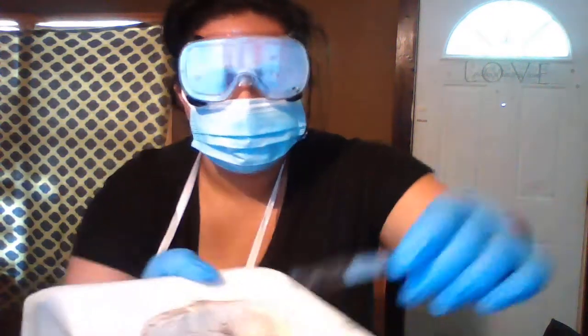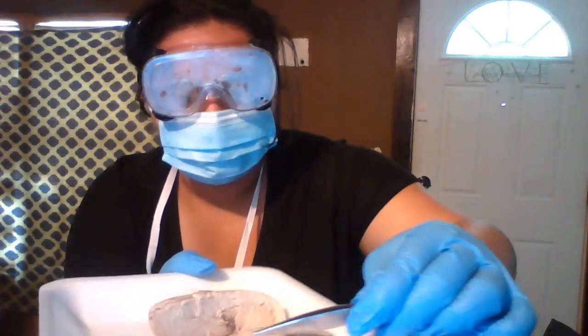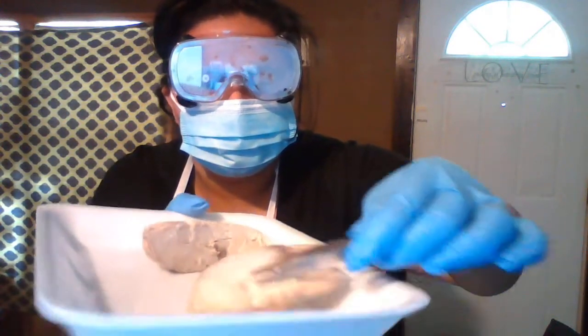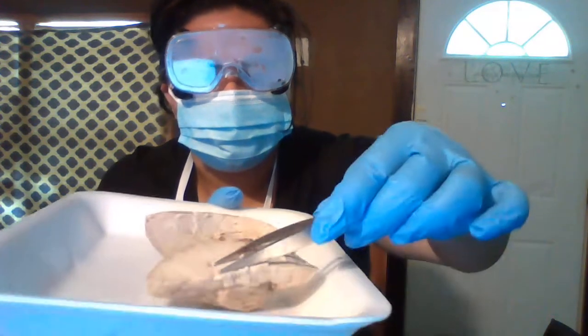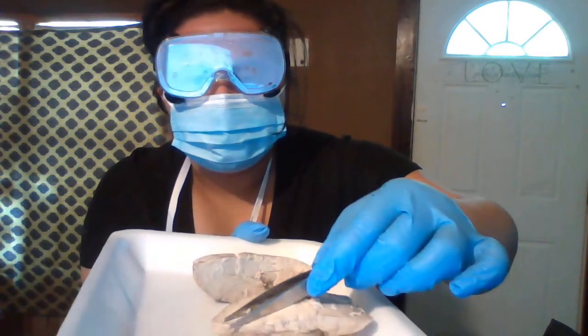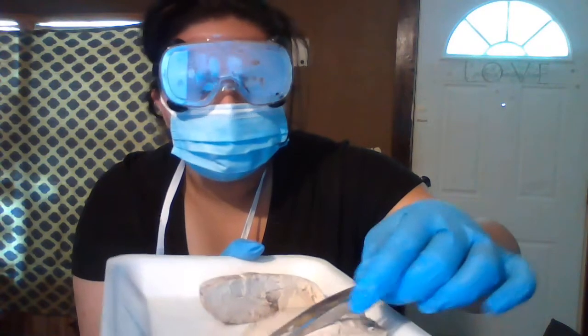So, taking a wild guess here, a leap of faith, I'm guessing this little bulgy area, the dark space, is the corpus callosum.